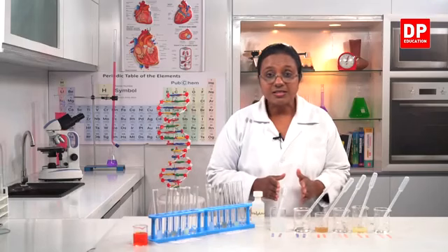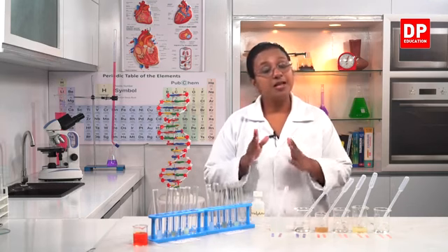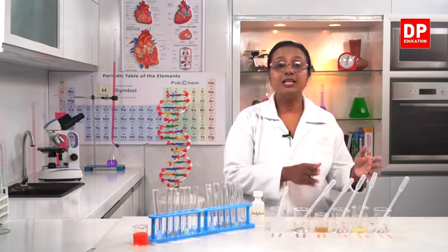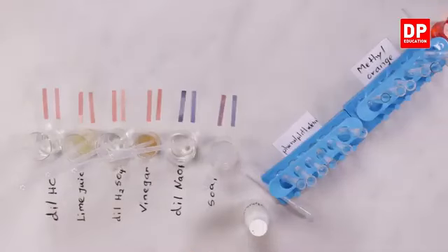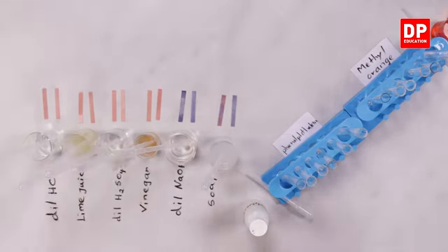So with bases, the red litmus becomes blue. But the blue litmus remains the same. With acids, the blue litmus becomes red. So here you can see all the acids: dilute hydrochloric acid, lime juice, sulfuric acid and vinegar. All of them, the color of the litmus paper is red.